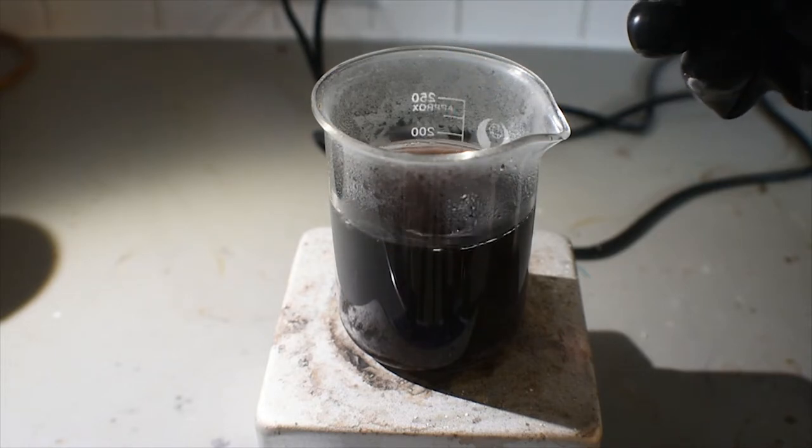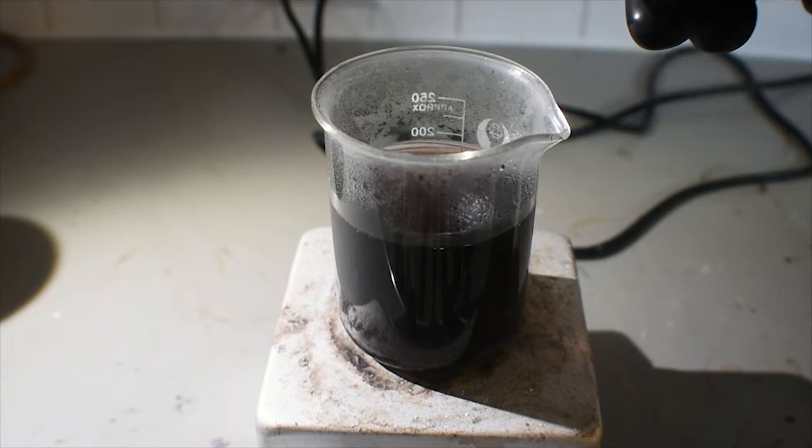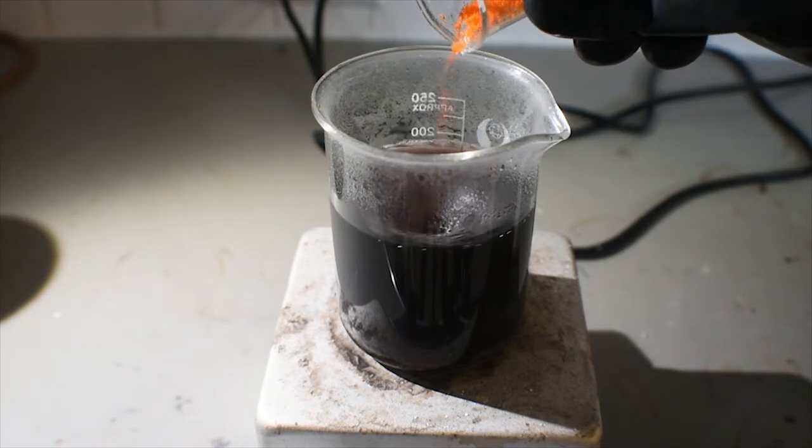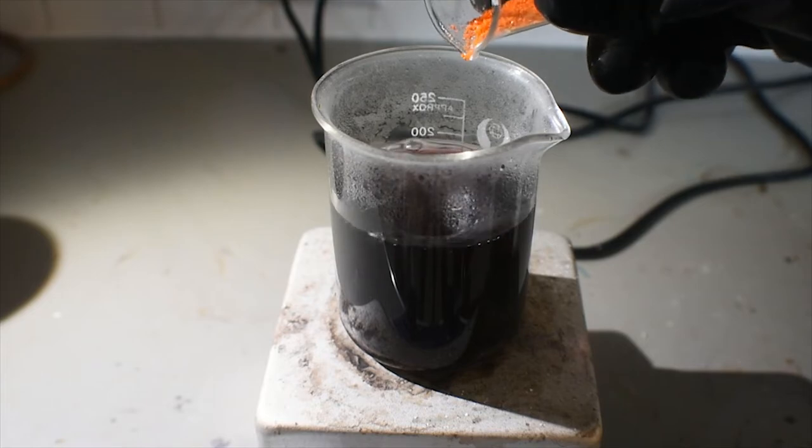The reaction is pushed along by the heat of the solution, and since I am using a near-boiling mixture of oxalates, it's going to proceed pretty quickly.